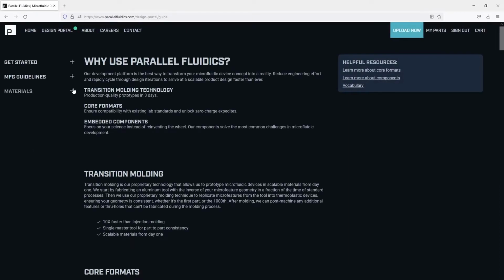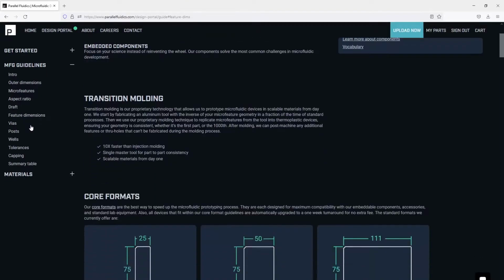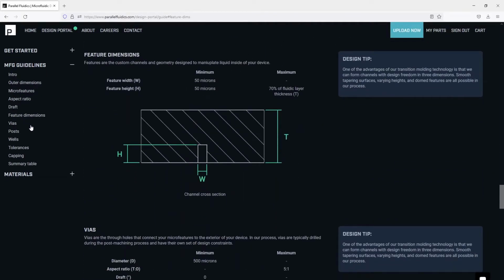When we expand the manufacturing guidelines in the table of contents, we can see design topics. If we select any one topic, it'll bring us to a section of that page with a quick description and some design rules. Let's choose Feature Dimension. This shows us a cross-section view of a microfluidic channel and calls out some minimum and maximum values. I want mine also to be small, but to be within guidelines, so I'll choose a nominal 100 by 100 micron cross-section. We can often produce devices outside of these guidelines, but if you can stay within them, it will reduce the cost and risk associated with making your prototypes.